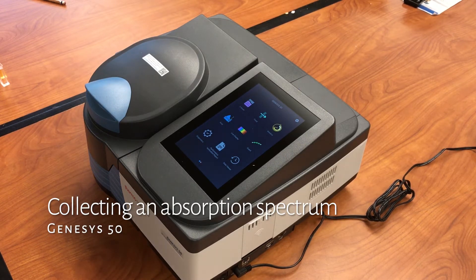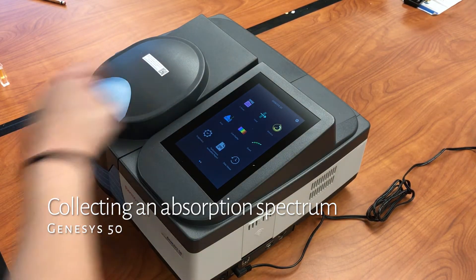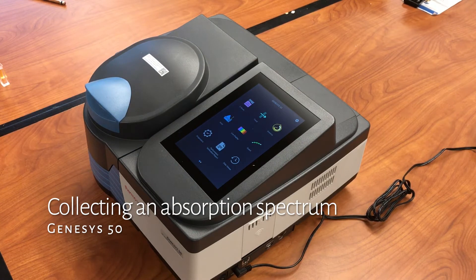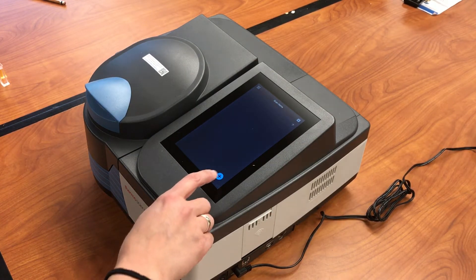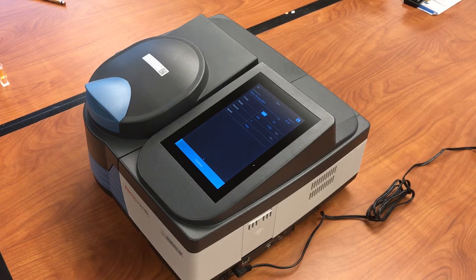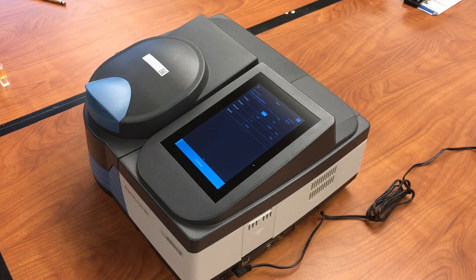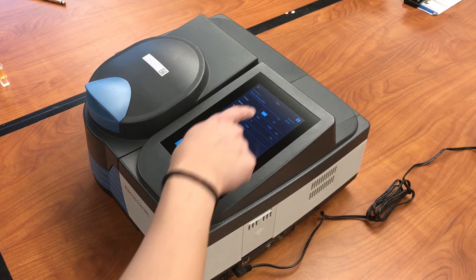To collect the spectrum, we're going to select scan on the touch screen, and then we're going to touch the plus sign, and this will open up a number of options for the instrument.